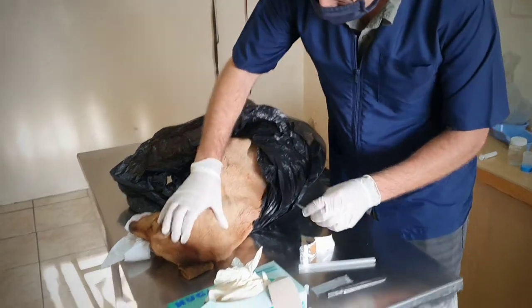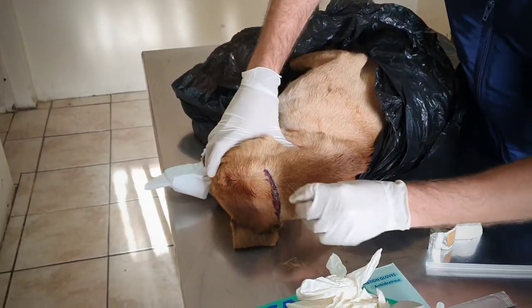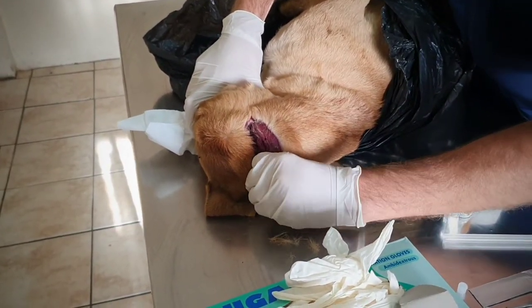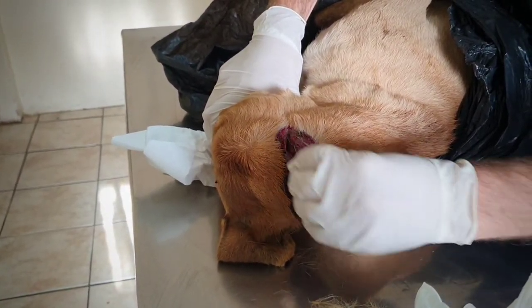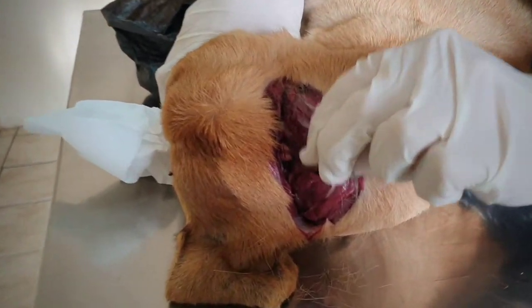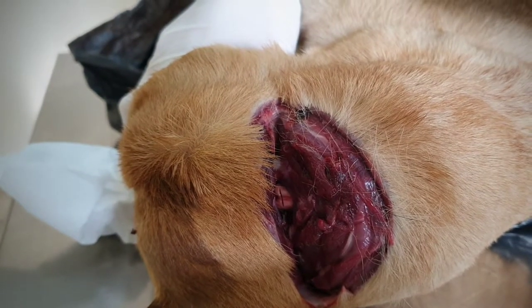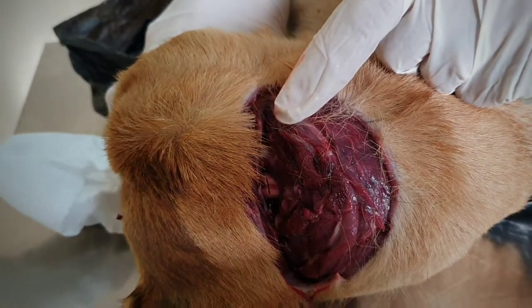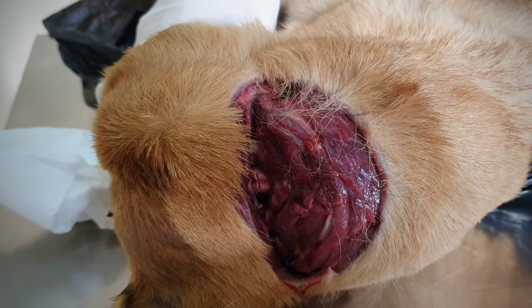As I say, cut down right at the base of the neck and the skull over there. Now when you get — I've actually already gone through it — usually when you cut down you can see the bit of membrane between the joint. When you pierce that membrane there's usually a bit of cerebrospinal fluid that runs out. The gap doesn't look that big but you'll be surprised at the size straw that you can get through that gap.